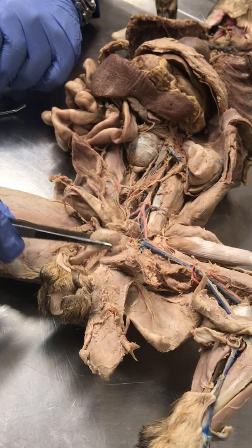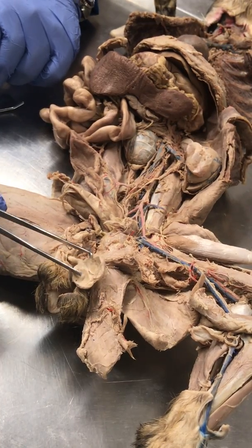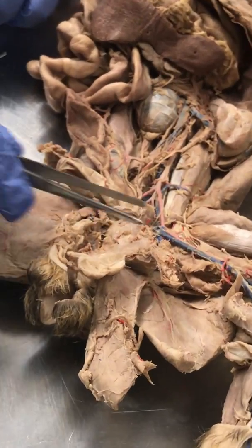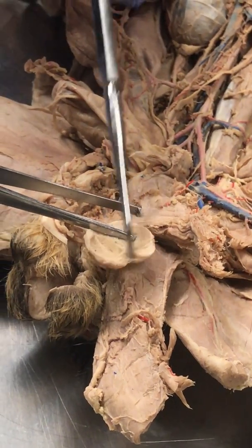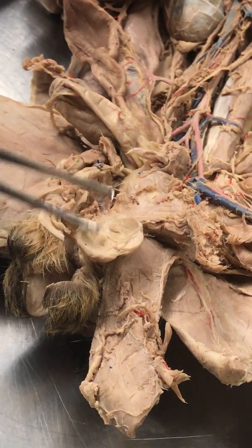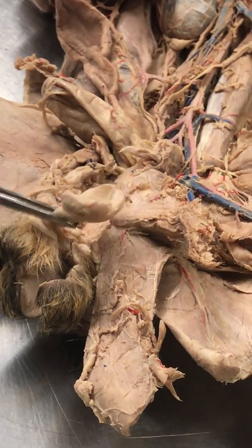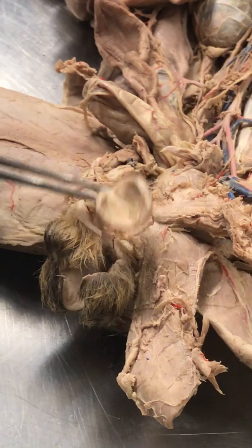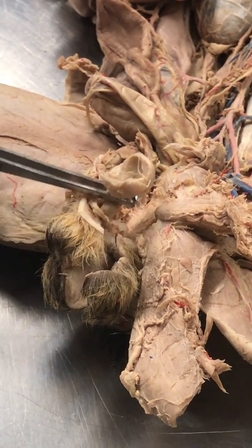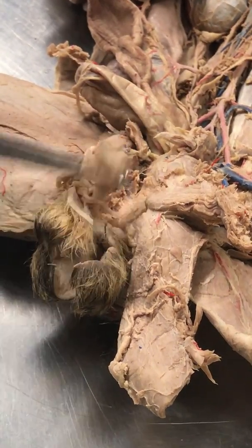Speaking of testes, this is a cat testicle. If you were to open it inside, you get to see, well, not much, but you can see two distinct structures on here. The top thing, you see right there, that is the epididymis, which means that the middle portion that I'm holding onto is the testes itself. Do you see the thing that I'm grabbing onto right here? That is the spermatic cord. And the spermatic cord has the vas deferens, testicular artery, testicular nerve, testicular vein, and some lymph tissue.